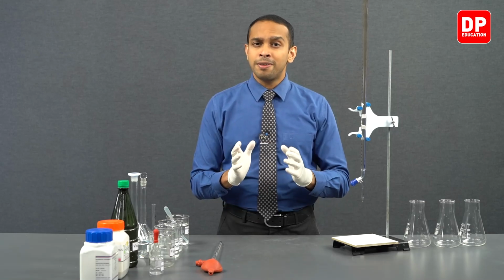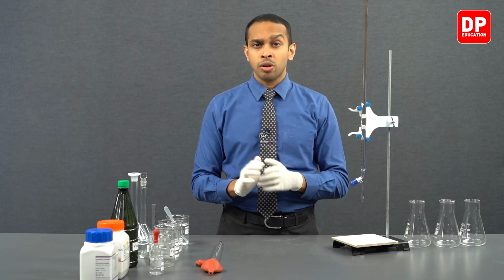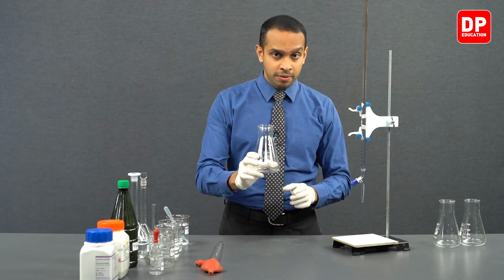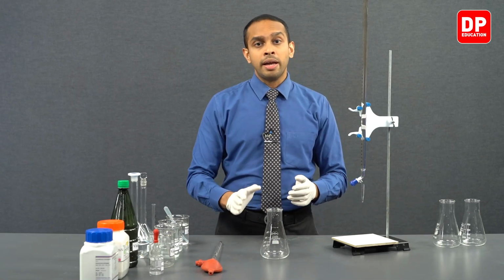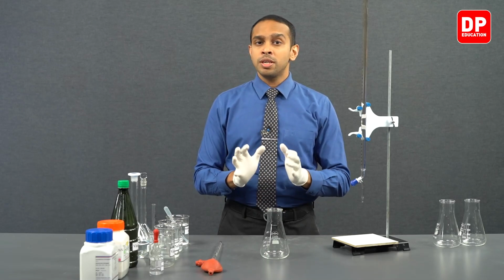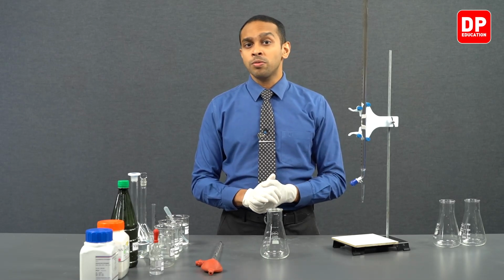We have filled the sodium hydroxide into the burette all the way up to the 0 line, and we are going to take 5 cubic centimeters of vinegar into a titration flask and dilute it with 10 cubic centimeters of water. So why do we have to dilute the vinegar?